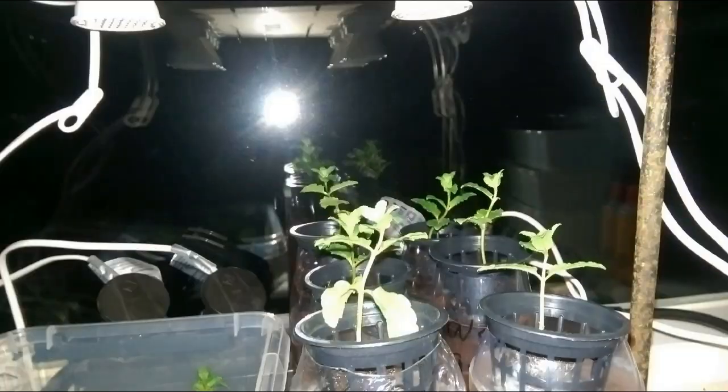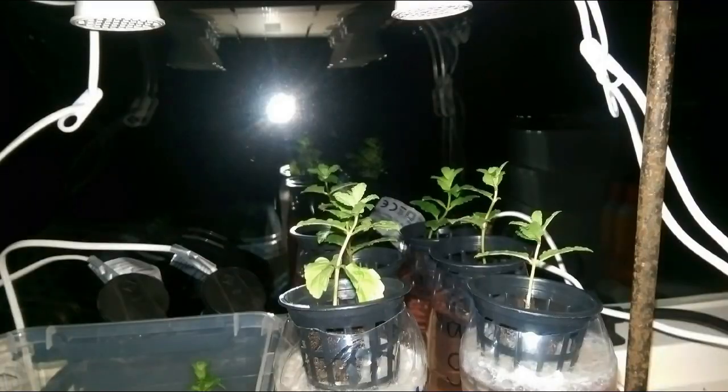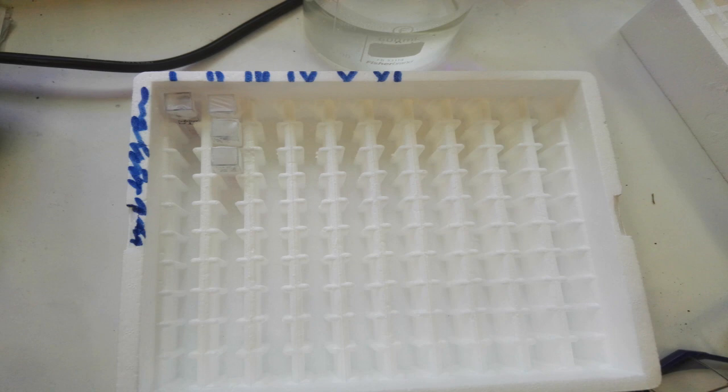Each week of the experiment, we made 2 new containers and added mint and gold to them, so that the plants would be exposed to gold at different sizes, to see if there was a difference. Every week we also took a sample from the growth solutions to analyze by UV-vis spectrometry.